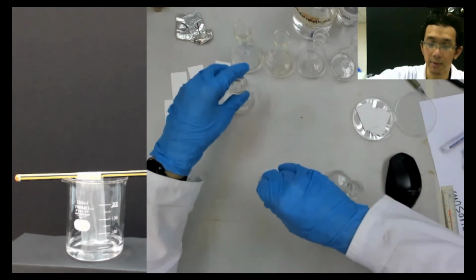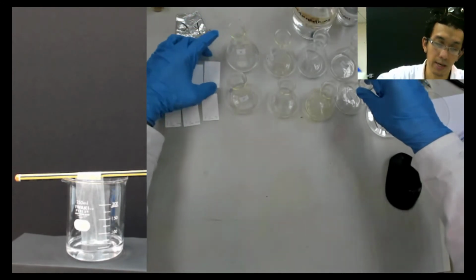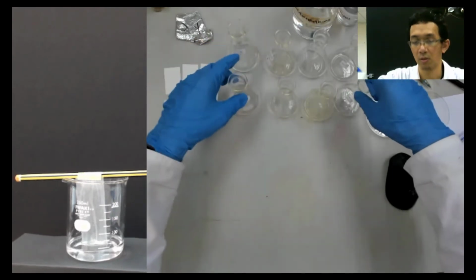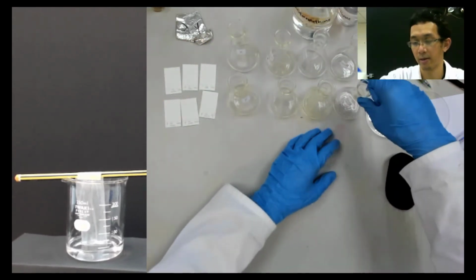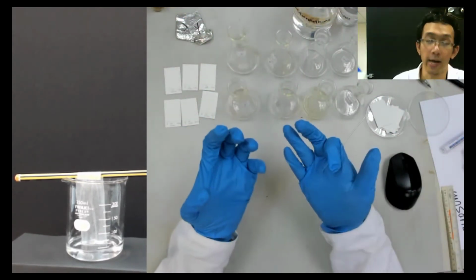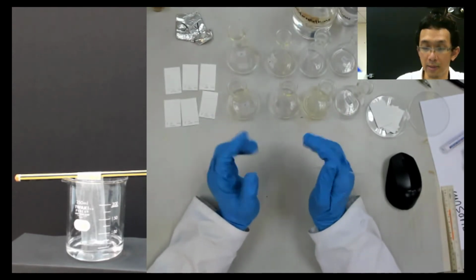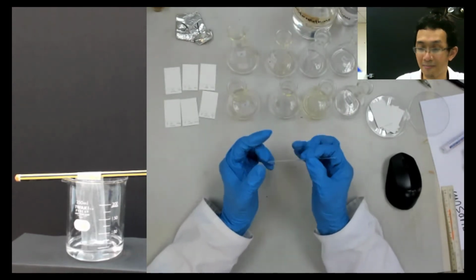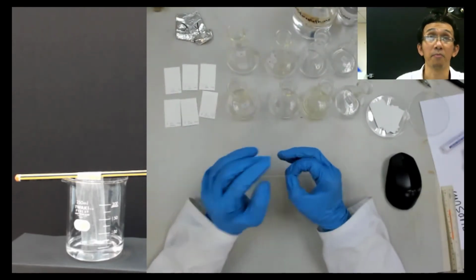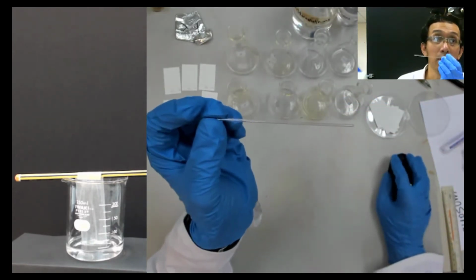Make sure everything is labeled when you do your work during FYP later on, because maybe now you cannot come to the lab, but later on, 2 years, 3 years from now, I hope that the COVID is already settled and you get a chance to work with your hands. So you need to remember the very important thing for lab is labeling. You can make all the stuff, but if the label is wrong, then your result will be messed up. So that's one thing. So how to make smaller, let me zoom a little bit.